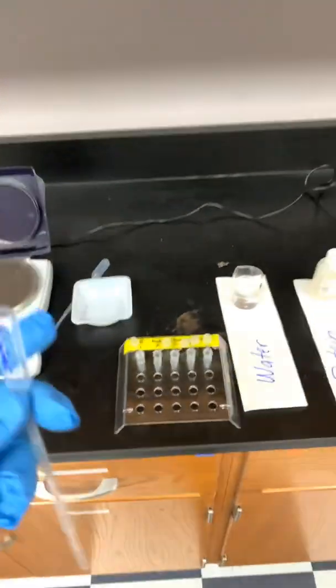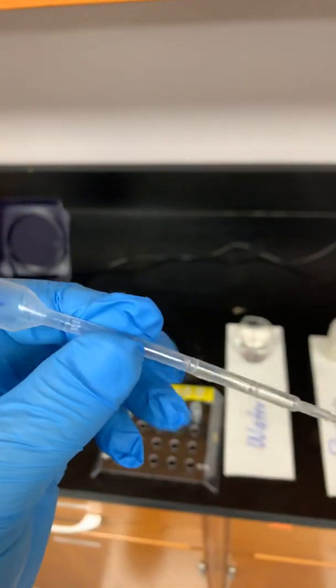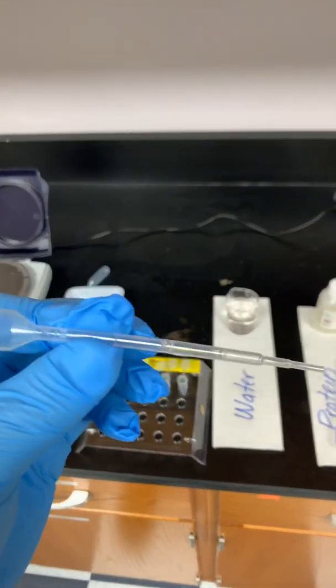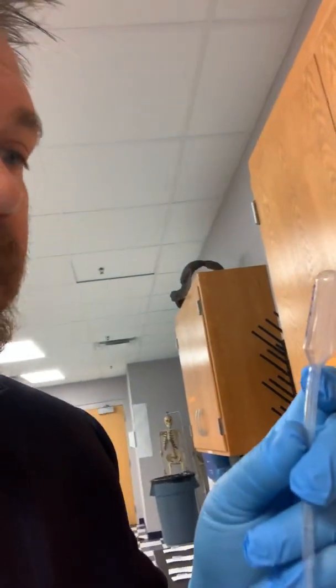So how did I know I had 1 mil and how did I know I had half a mil? On the side of this, it has the volumes. So you see all of these lines coming up through here. There's one, bear with me, I've got one. And here, there's one. Let's see where the best place is. 1 mil is all the way up here. And if you look at that closely, you'll see that it says 1 milliliter. Down here, it says 0.5 mil. So the lines in between are the other gradations in between. So you have 1 mil, you have 0.75 mils, you have half a mil, 0.25 mils. Again, the ones you're really wanting to look for are actually labeled on here, the half mil and the 1 mil on that transfer pipette.